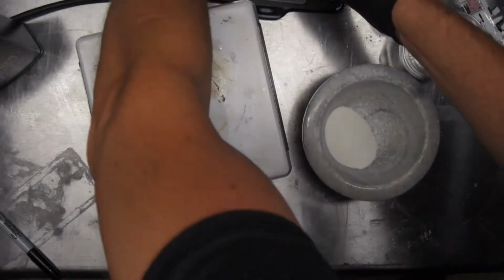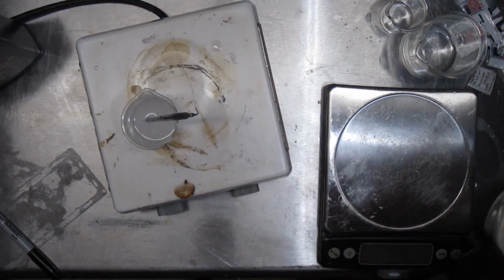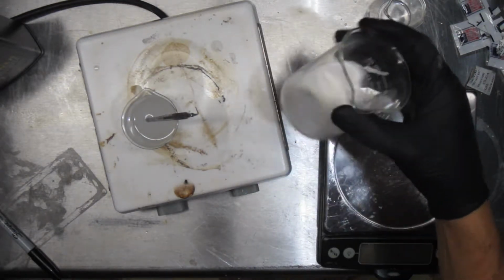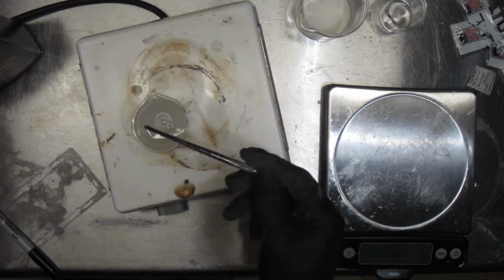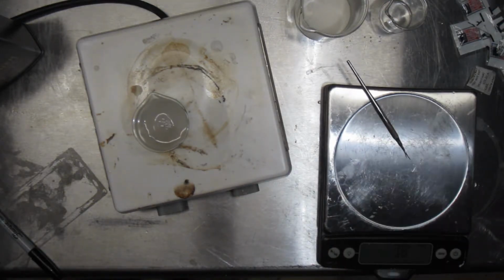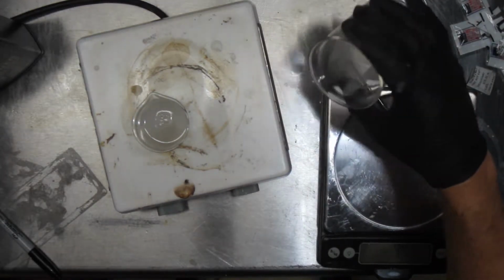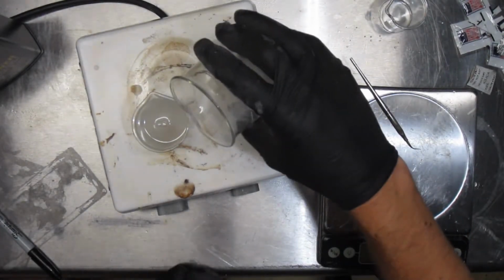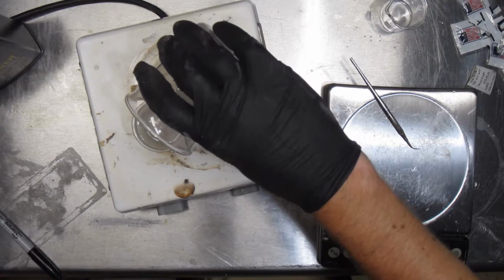So while I'm waiting, I'll weigh out my 18 grams here to make sure we have enough. We've got 18 grams of this lovely, lovely powder now. This is just going to be great for that. All right, I think we're dissolved there. So let's start adding our silicon dioxide. Now I think this is also an exothermic reaction, folks, so we're going to get some boiling action happening, I think. We'll just start slowly adding this.